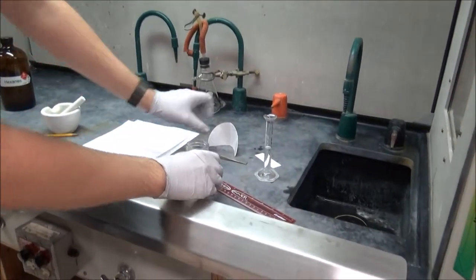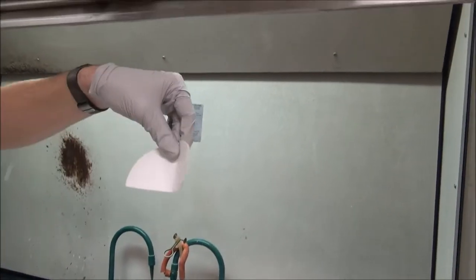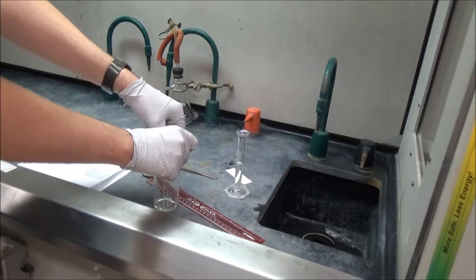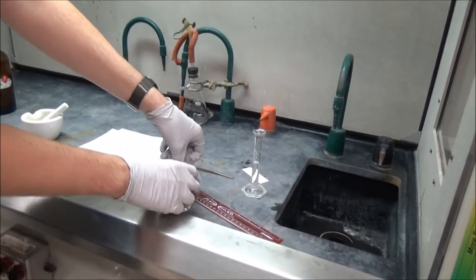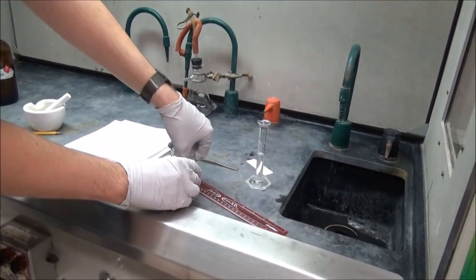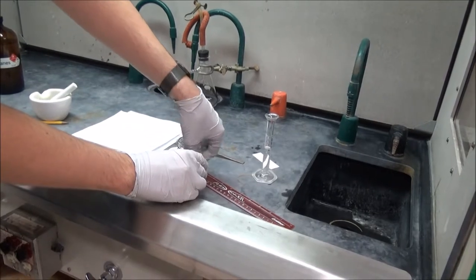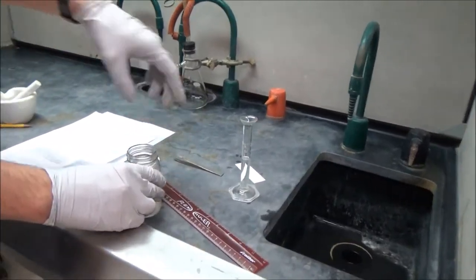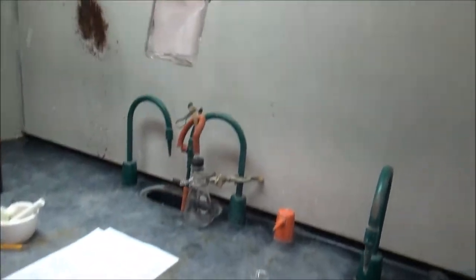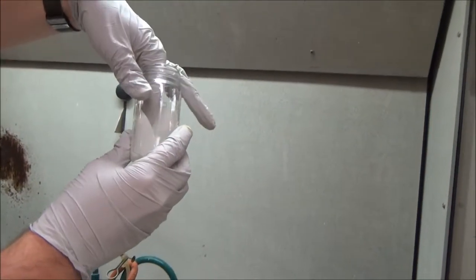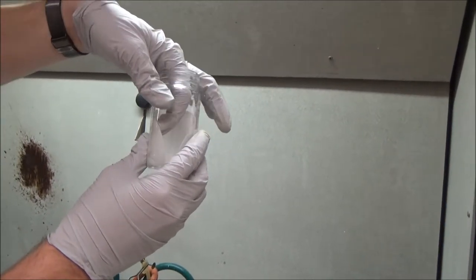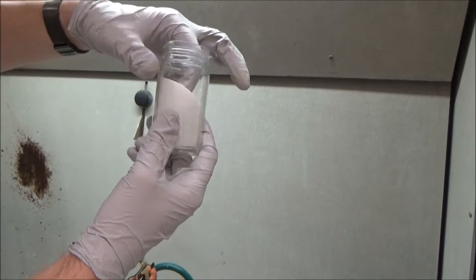Now that's prepared, I will be putting a small piece of filter paper that I folded in half, and I'll be placing it against the sides of this TLC chamber. The important thing is to make sure that all the sides of the filter paper are placed flush against the sides of the chamber.